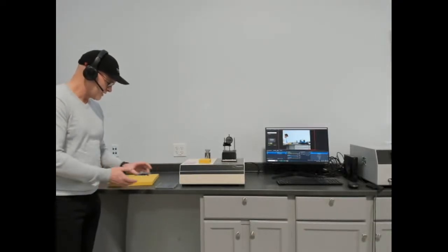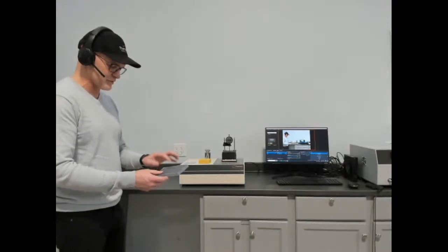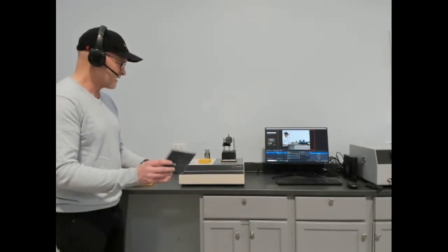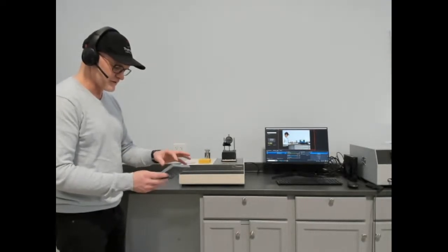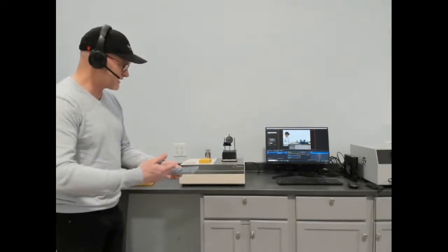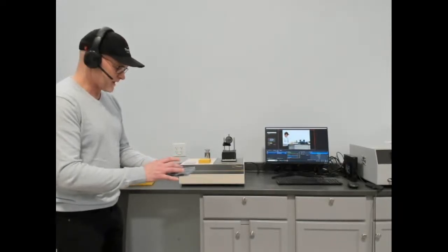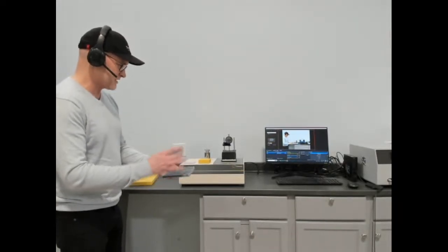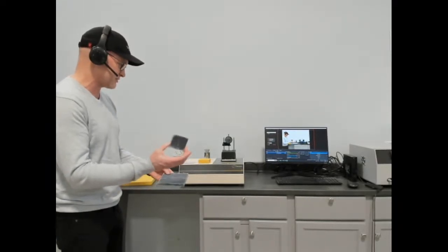But we're going to measure what is typically a difficult material to measure by any other method than thermal resistance or heat flow meter. This is an aerogel blanket. This is about 10 millimeters thick, or 9.5 millimeters thick. Classic material. It's highly anisotropic due to the internal structure and use of aerogel. And we're going to be using a much smaller piece than you would need for a large heat flow meter. This is approximately 2 inch square.